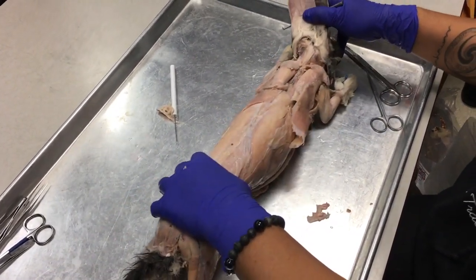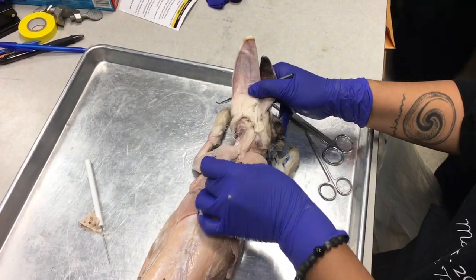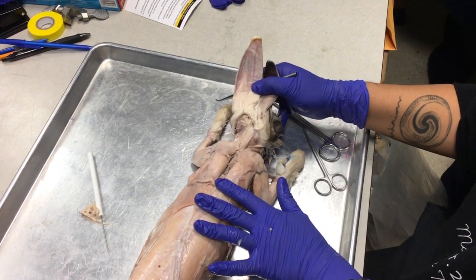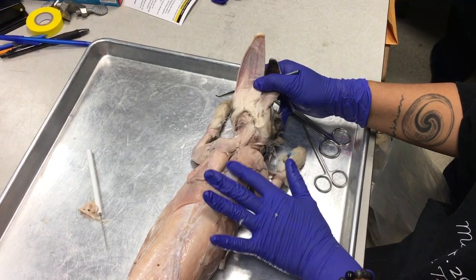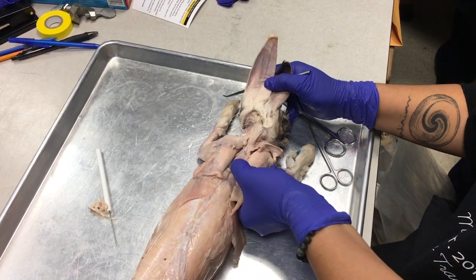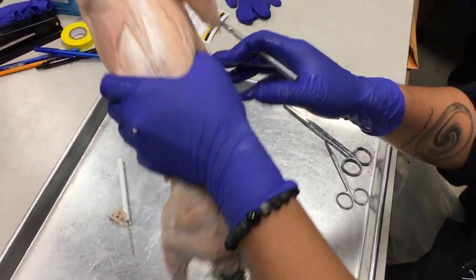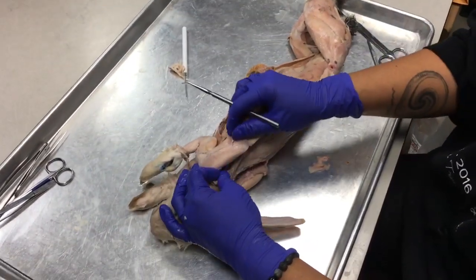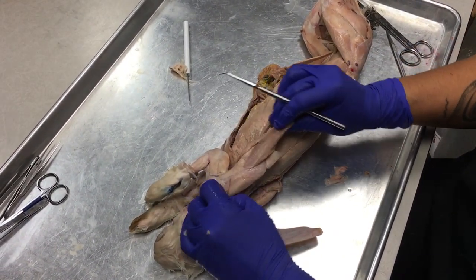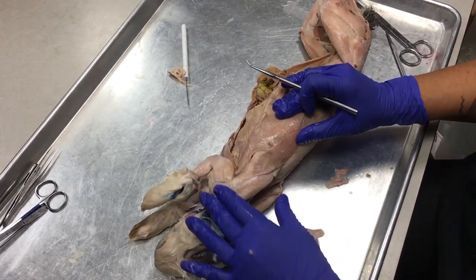Now let's travel back up to our shoulder here. And I want you guys to see that what Tori did here was she cut through my spinodeltoid muscles, and I'm sure the acromiodeltoids were under here, but since we can only see parts of each, we're doing clavo and spino. Thank you. Okay, so what she's done is she's cut through the clavodeltoid here, cut through the spinodeltoid here, and then kind of cut through this big latissimus dorsi.